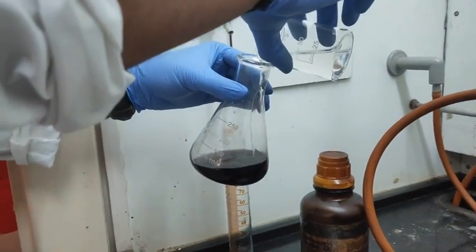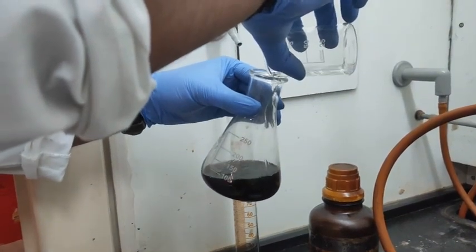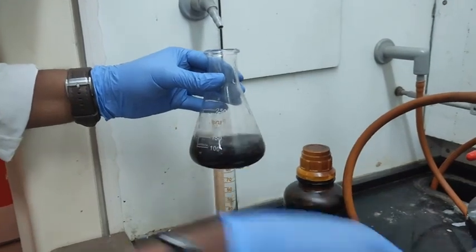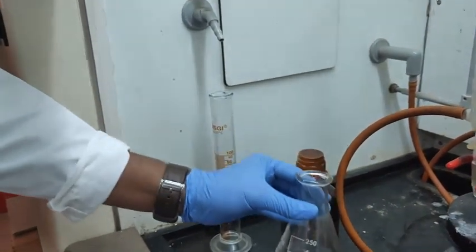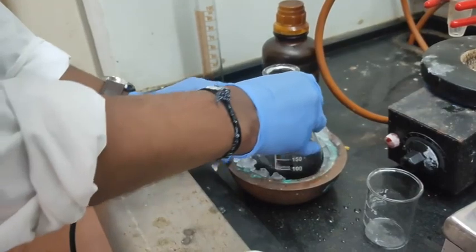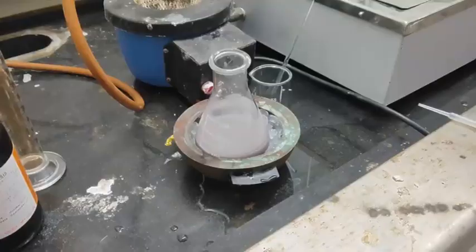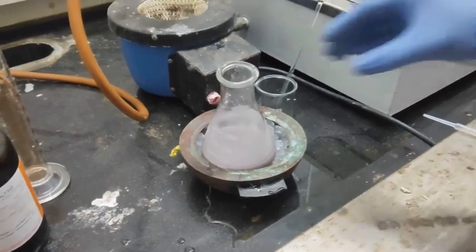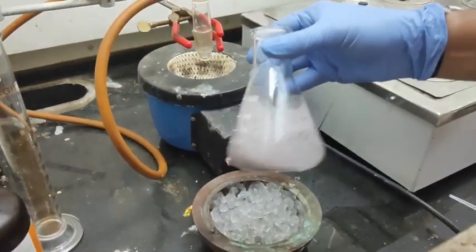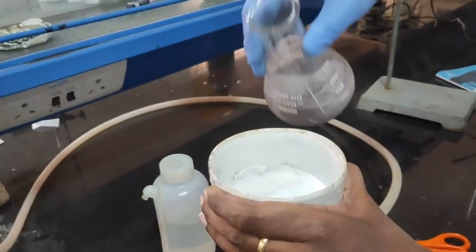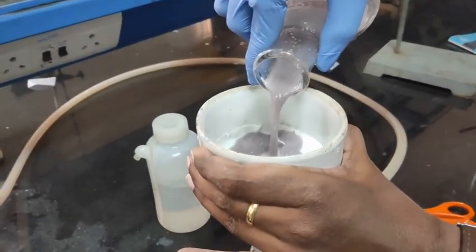Remove the solution from heating and pour all of the sodium acetate solution and mix well. Cool on ice to precipitate the product. Filter the solid residue formed and keep for drying.